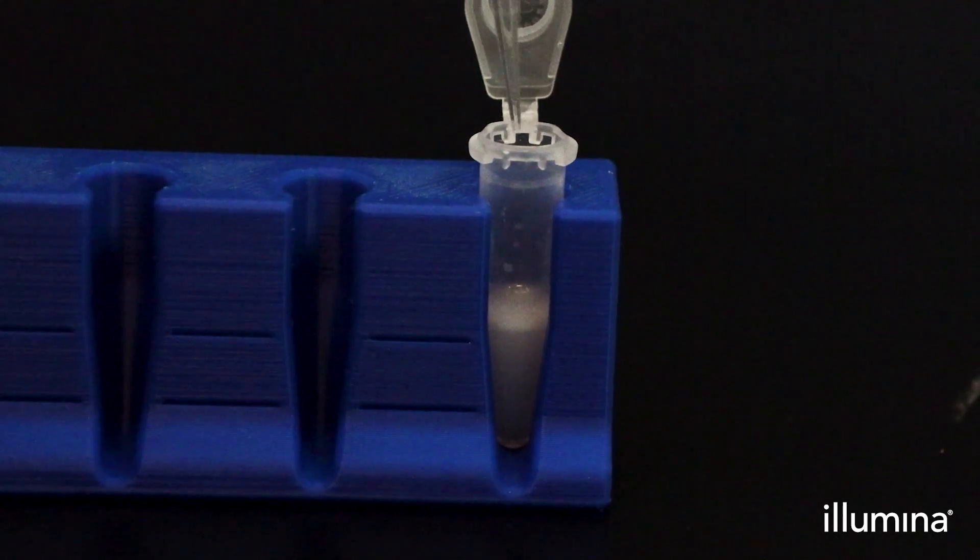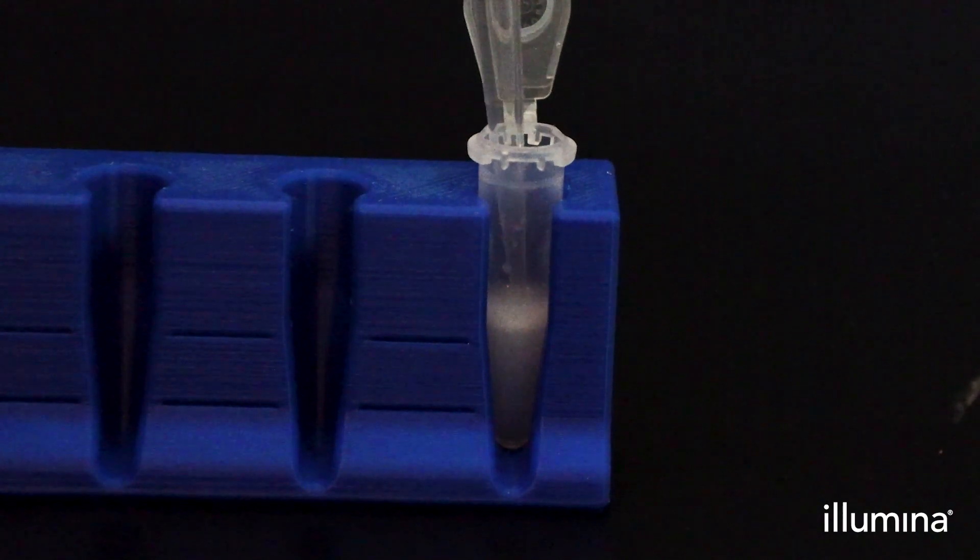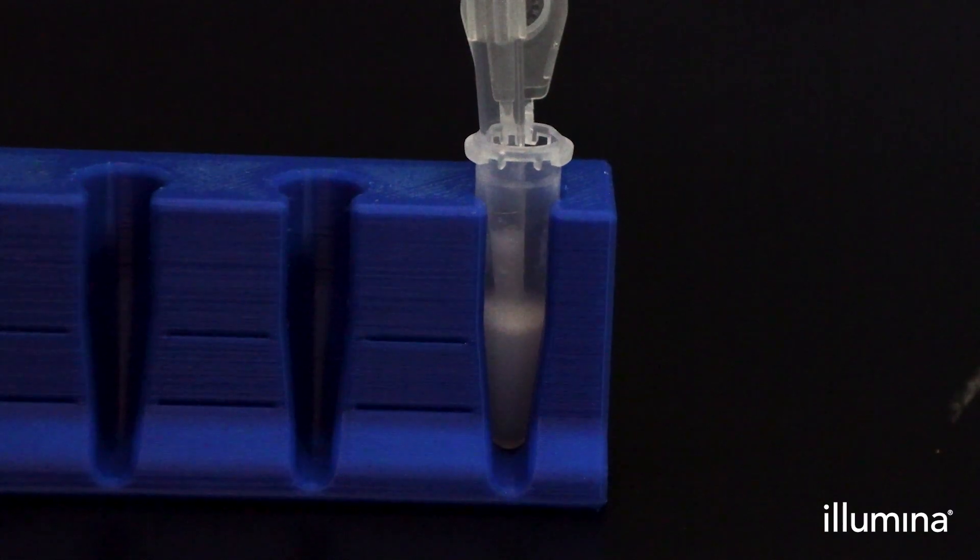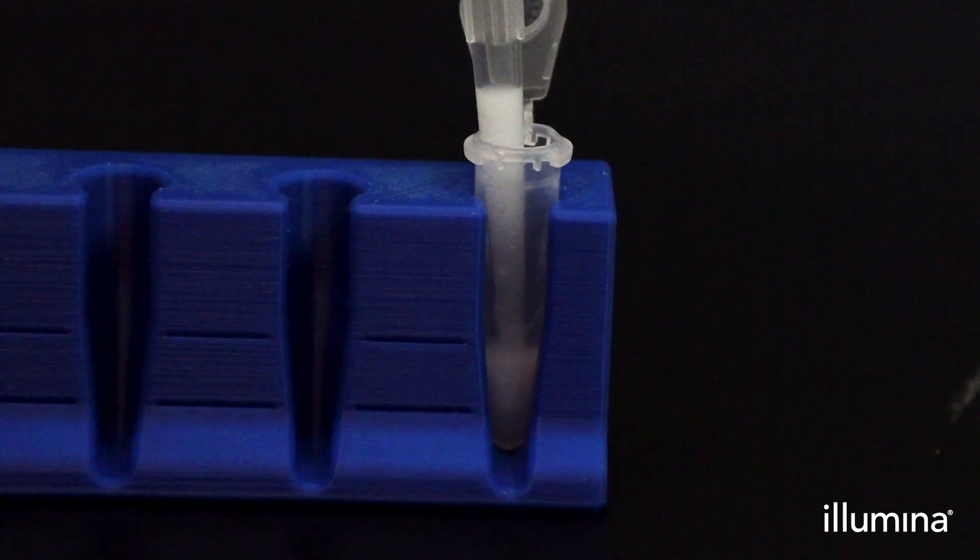After preparing all your mRNA isolation reagents as detailed in the user guide, place PIP tubes in the four tube stand and aspirate up to 130 microliters of excess partitioning reagent out of the bottom phase, being careful not to aspirate out any of the upper emulsion phase.